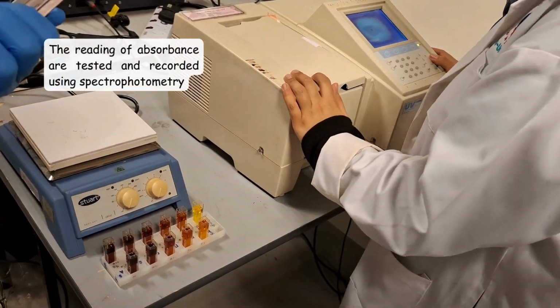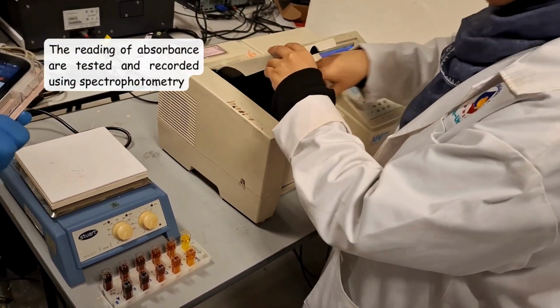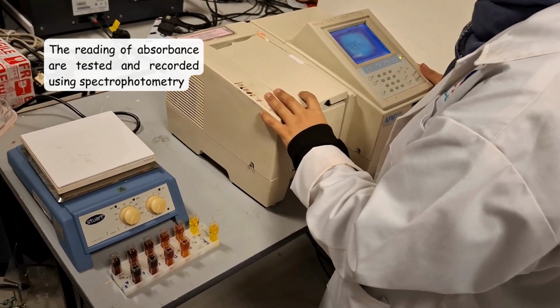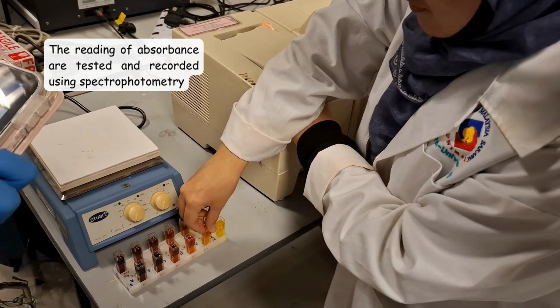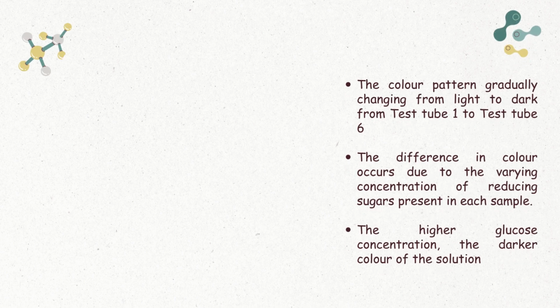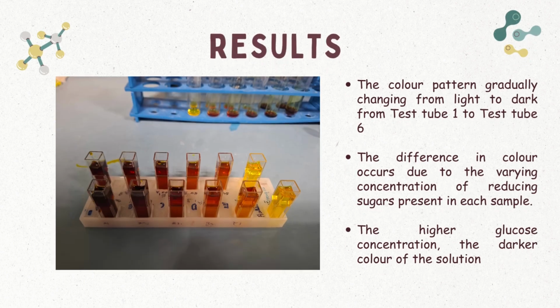Last step, the absorbance is measured and recorded using the spectrophotometer. The reading starts from test tube 1, then test tube 2, test tube 3, test tube 4, test tube 5 and test tube 6. In this experiment, based on this picture, the color gradually changes from light to dark from test tube 1 to test tube 6. The difference in color occurs due to the varying concentration of reducing sugar present in each sample. The higher the glucose concentration, the darker the color of the solution.